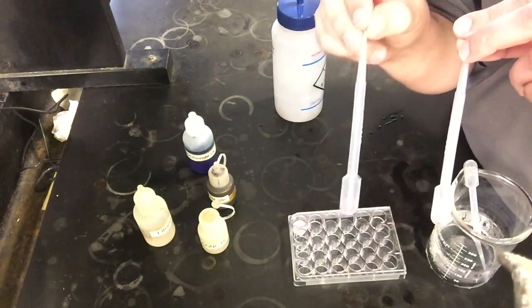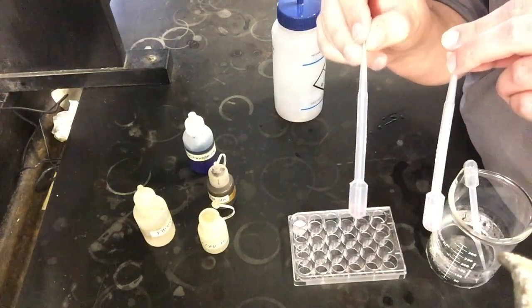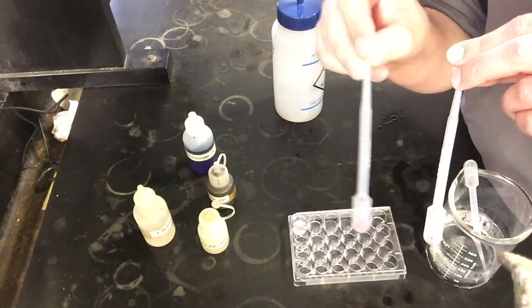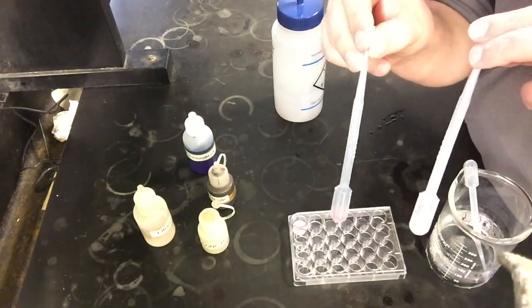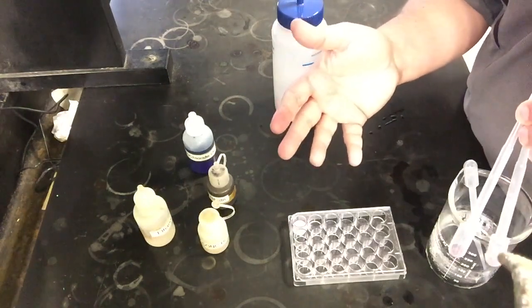So hot water favored the bluer color. Even though it didn't convert everything over to that blue color, that's fine. It shifted it in that direction. So basically the heat helped shift it back towards reactants, which was the blue color. Cold helped shift it towards the products, which was this lighter pink color. So that should be all of the visual demonstration of everything from this experiment.